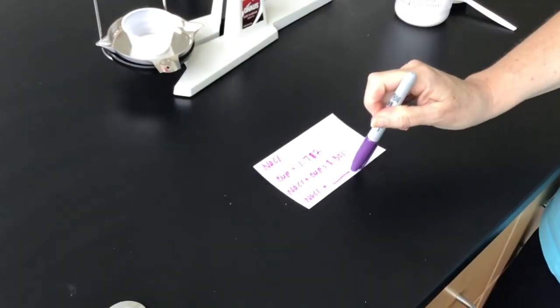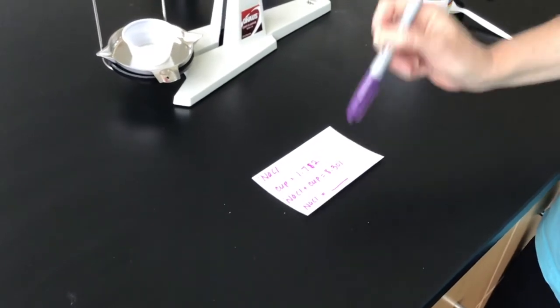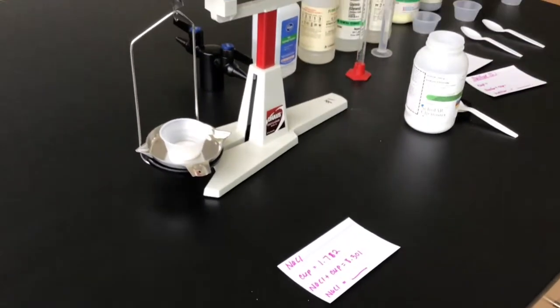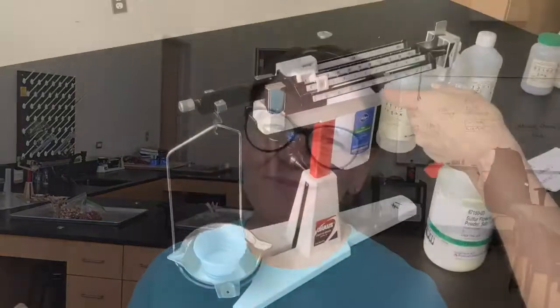And so now you are going to have to calculate just the mass of the sodium chloride to complete the analysis of the lab. We do not want to take into account the mass of the cup. So this is where we do massing by difference. If you will recall, we've done this in multiple labs this year where you subtract. Okay? All right, so now I'm going to stop here and I'm going to do the other 3 solids quickly and show you the data so that you don't have to sit and listen to me talk the entire time.